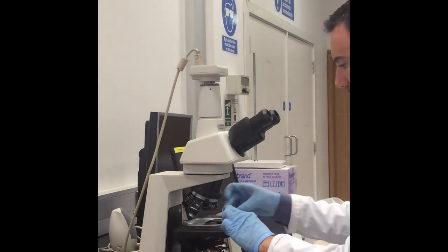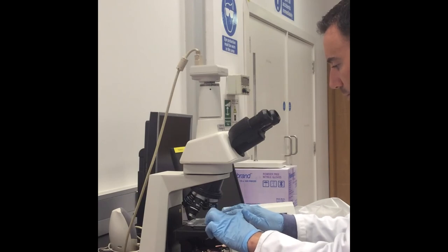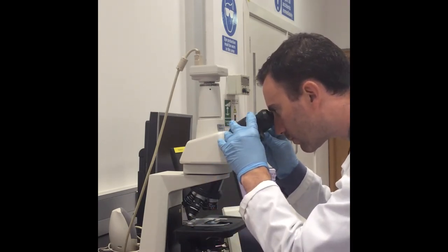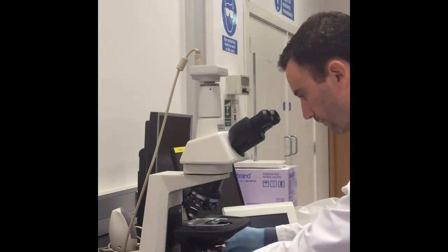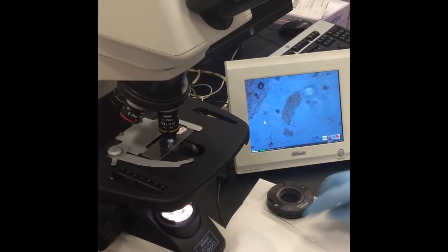Place the slide on the microscope tray. Use the binoculars to zoom in on your desired region. Once happy with your desired region, you can then flip over to the monitor display. When you've identified all the different parts of your cell on your slide, you can then image what is displayed on the monitor.